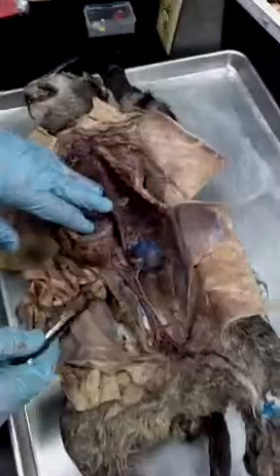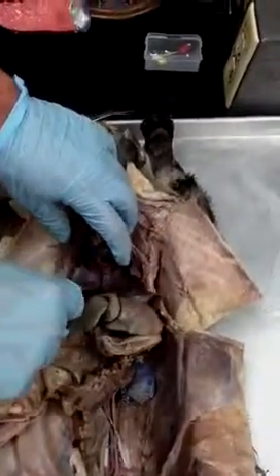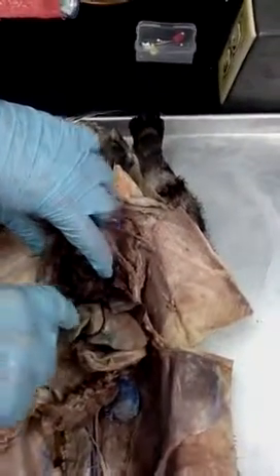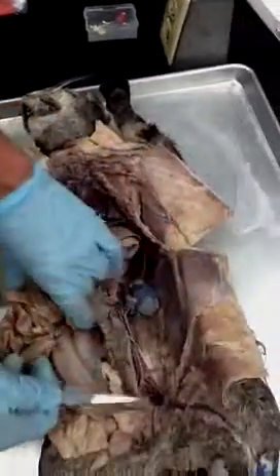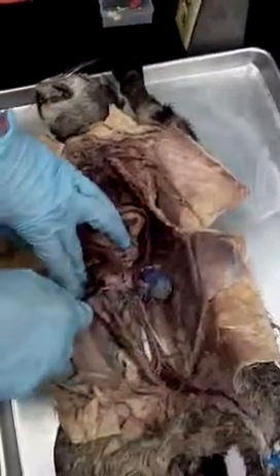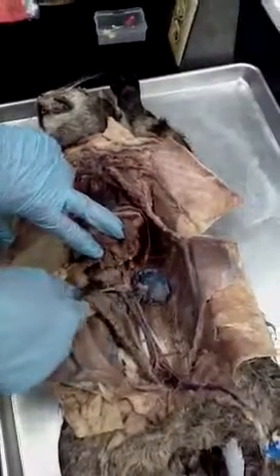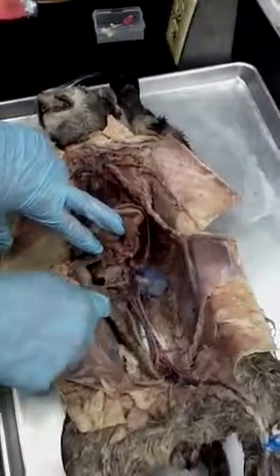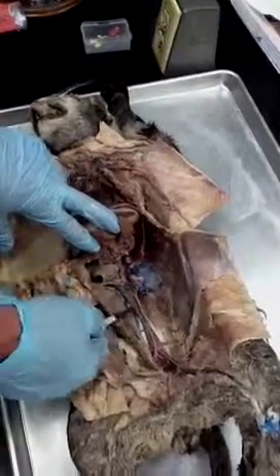And the veins pretty much do the same thing, except the inferior vena cava will be coming in the base of the heart right here, inferior vena cava. That'll go through the diaphragm, through the liver. We'll pick it back up down here in the abdominal cavity. Got the renal veins going to the kidney. They're coming back from the kidney, should I say.